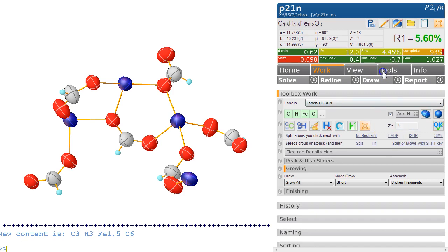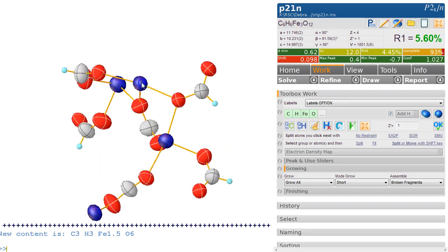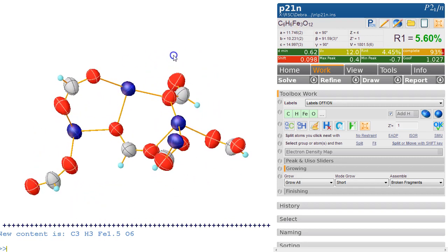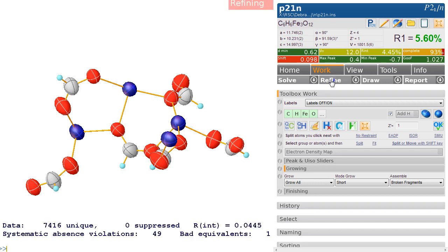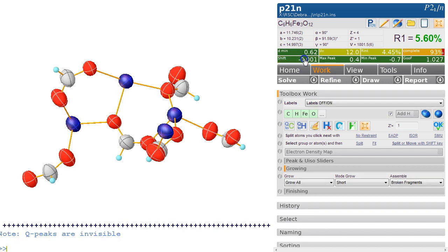Does that make any sense? Now that doesn't make any sense. What about just 1? And we have a unit of C6H6 Fe3O12. Now this is very much a chemical decision that has to be made, what formula you would like to choose here. Anyway, there's still some shifts, so we refine this some more, and we hope that this shift will stop and settle. Has that settled?